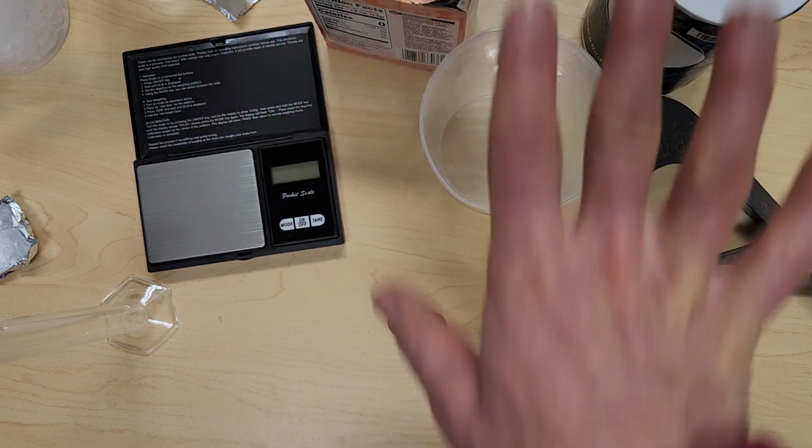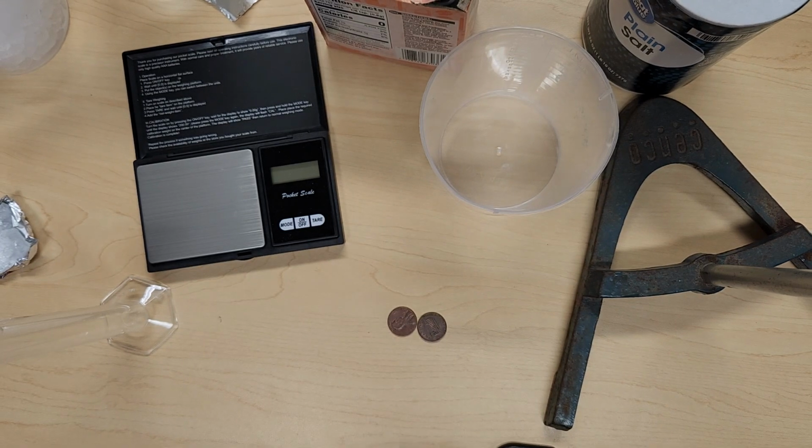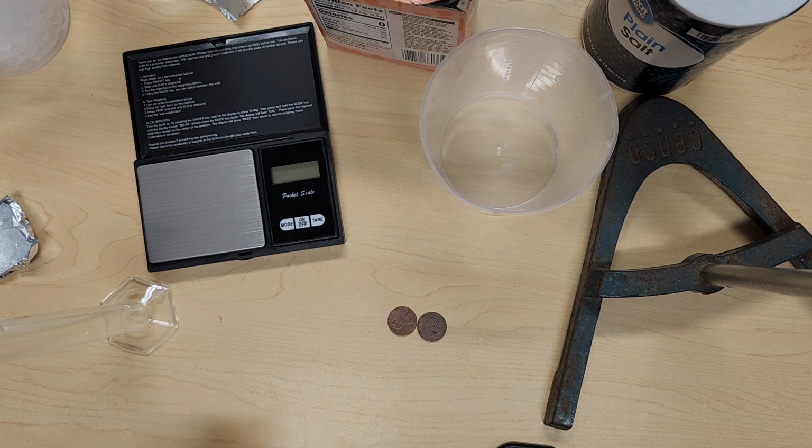Okay. Then you can clean up all your materials, you can take your goggles off, okay, and think about other places. So there's a question that asks you, where other places have you observed either a physical or a chemical change in your life? And then you're going to include your pictures and observations in the report form for the lab.